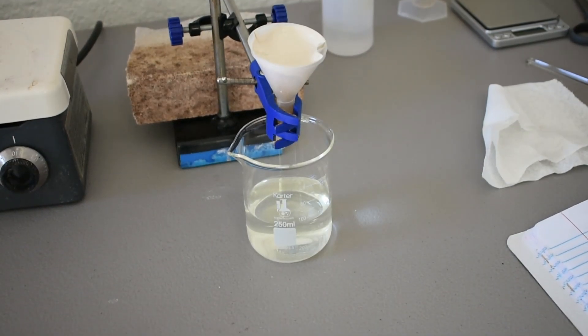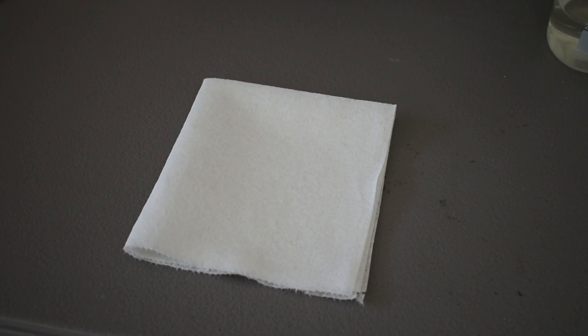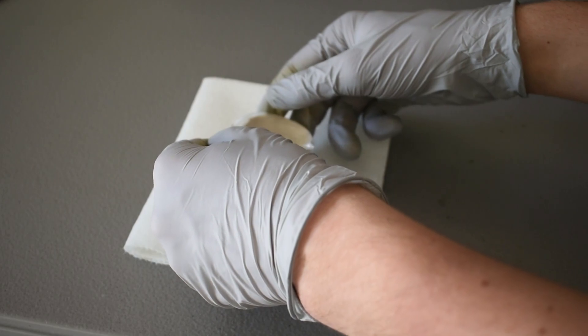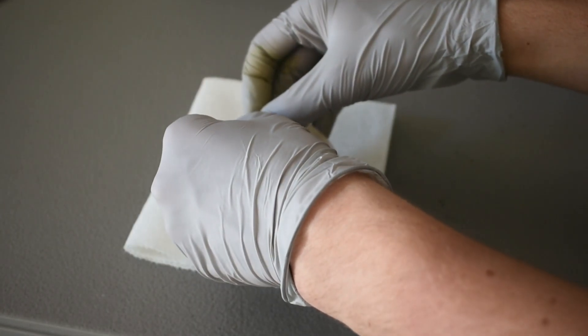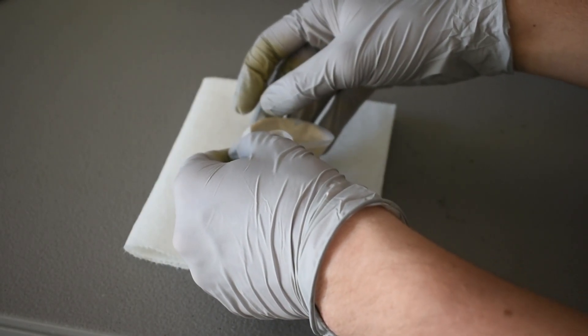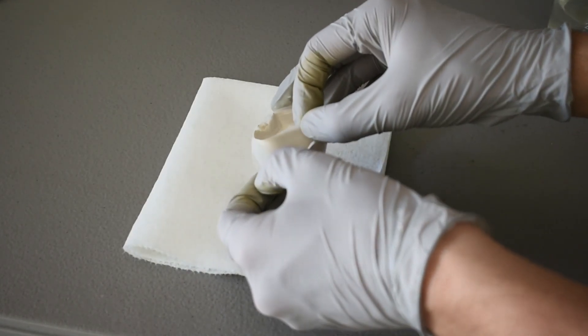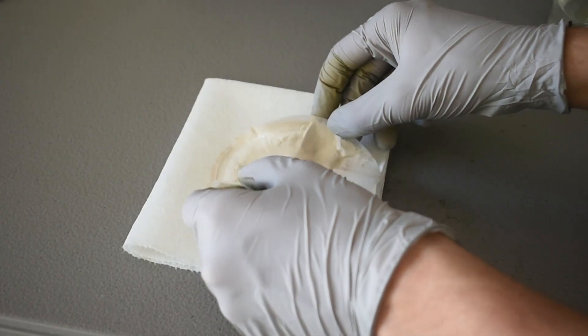I'm finished filtering, and what I'm going to do is I'm going to move our copper iodide to this pad of paper towels for it to dry. But I will not let it dry completely because it likes to oxidize in air. And I kind of want this to be as pure as possible. So it's recommended that it's stored underwater. Let me grab our filter. And it was very full. I kind of pushed the limits of that size. It ripped. That's unfortunate. There we go.